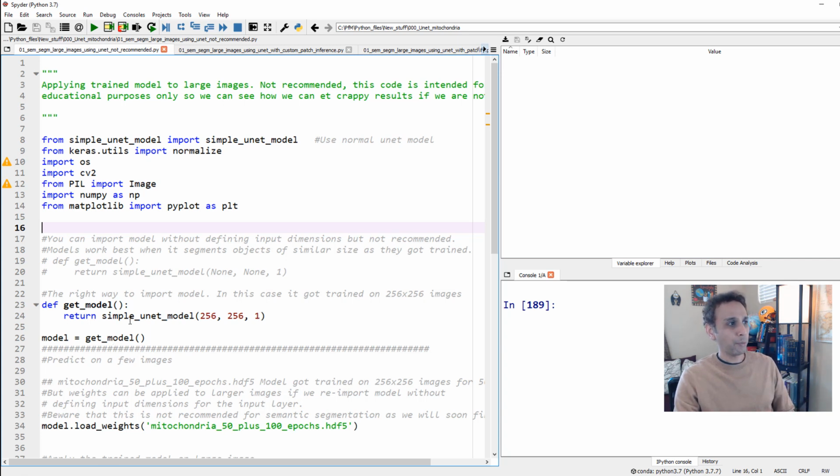So I'm going to import my model. I already have it in a separate file called simple unet model. Again, nothing to see there. As it says, it's very simple. There is an encoder, there is a decoder part, and that's pretty much it. I'm going to share those files, so don't worry about it. And everything else is pretty straightforward.